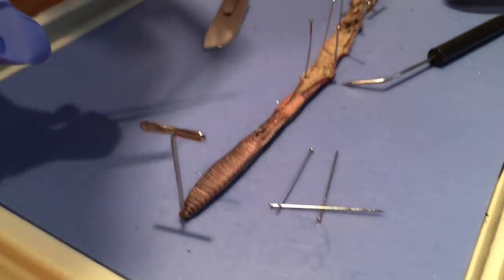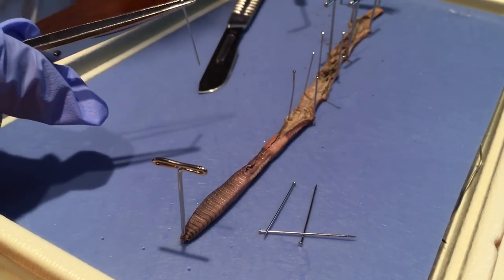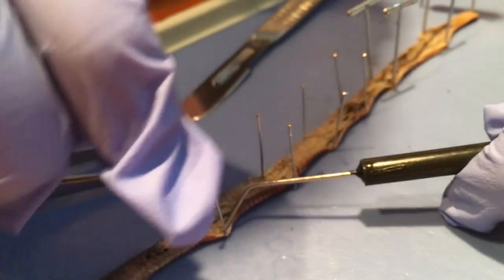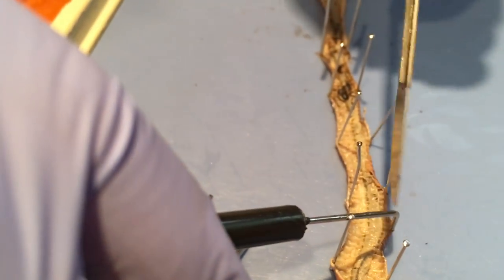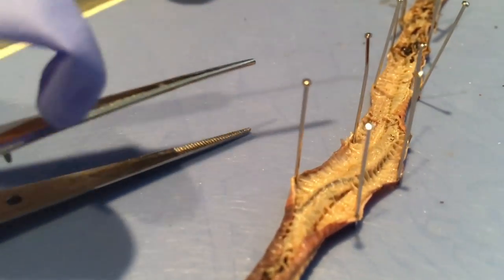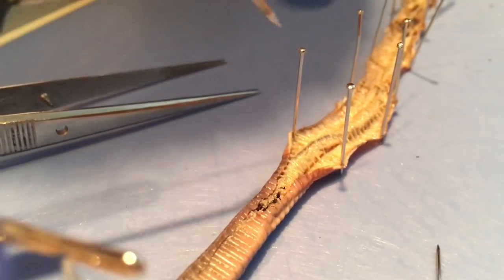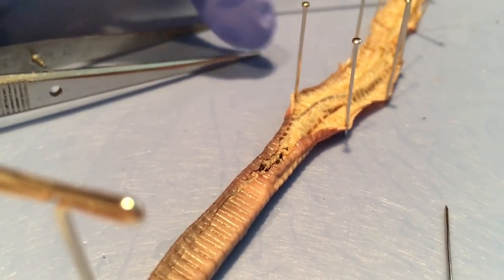I'm just going to take this pin and my wedger. We didn't get a ton of pins. As you can see, this is very easy to open right close to the egg sack. There's a lot of guts there. I've got the large intestine right here, and I believe this is the small intestine with all the poop. As you can see there's some right there — it's nasty.